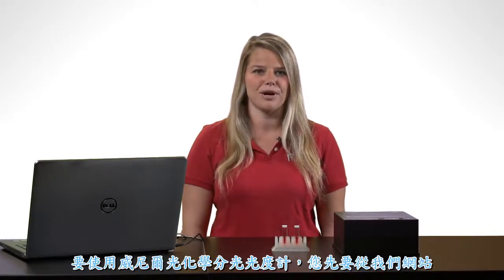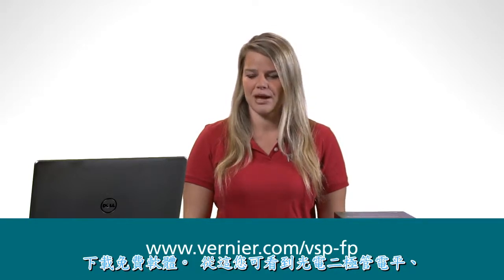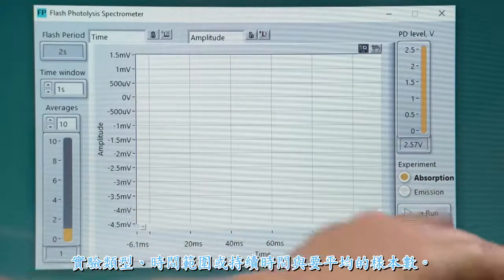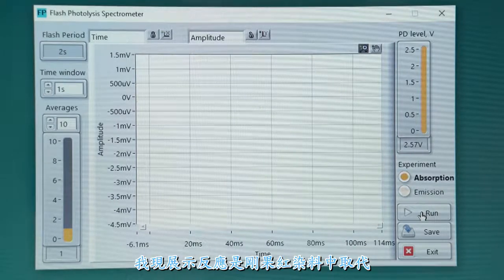in Logger Pro software. To use the Vernier flash photolysis spectrometer, you first need to download the free software from our website. From here, you can see the photodiode level, the type of experiment, the time window or time duration, and the number of samples to average.